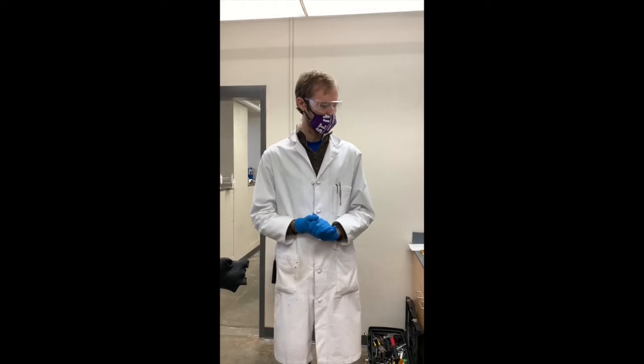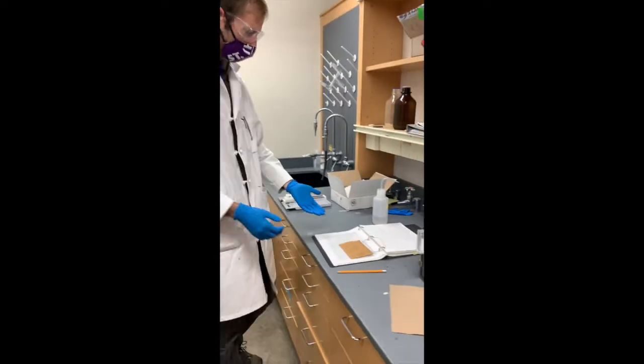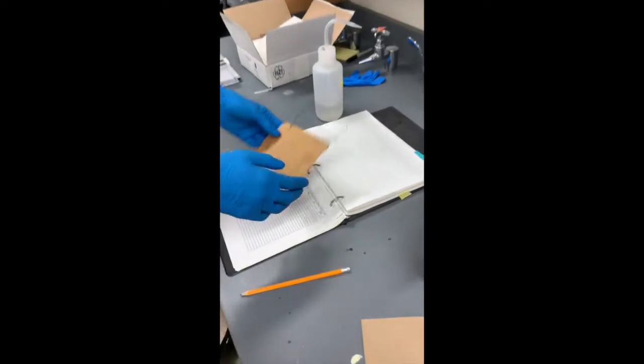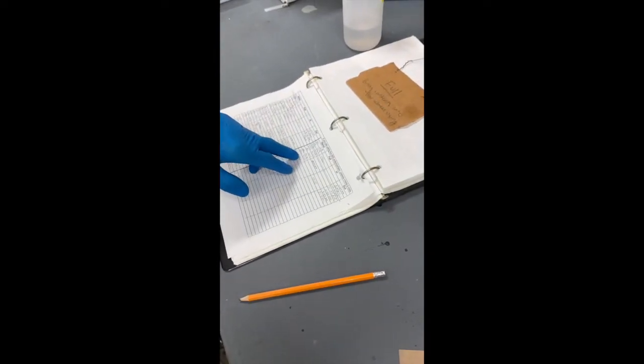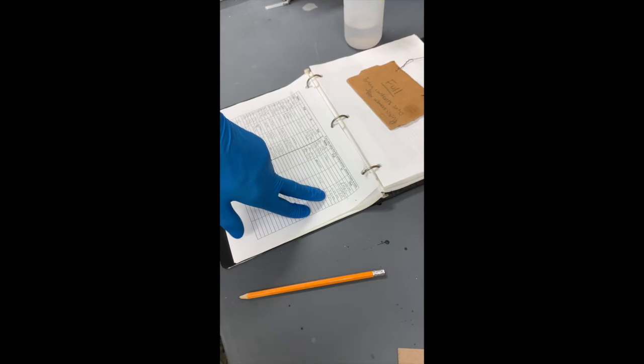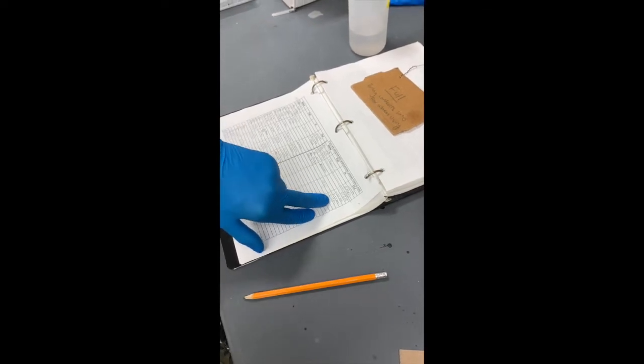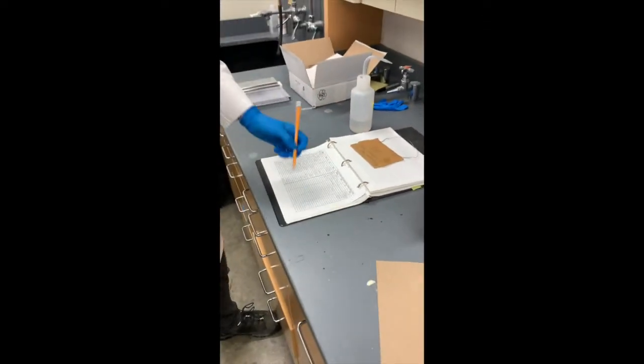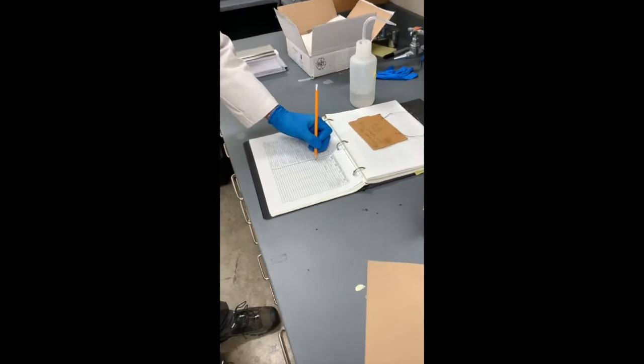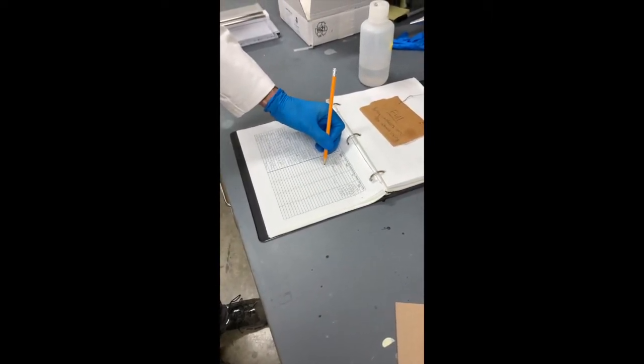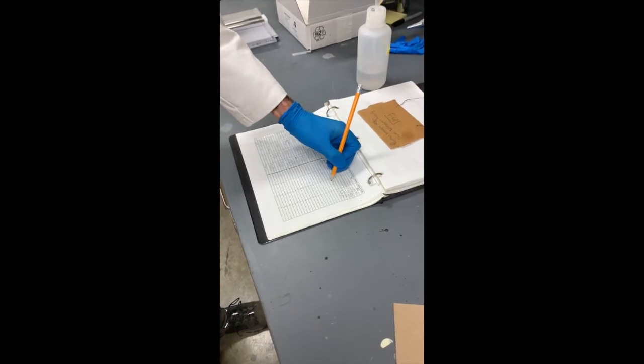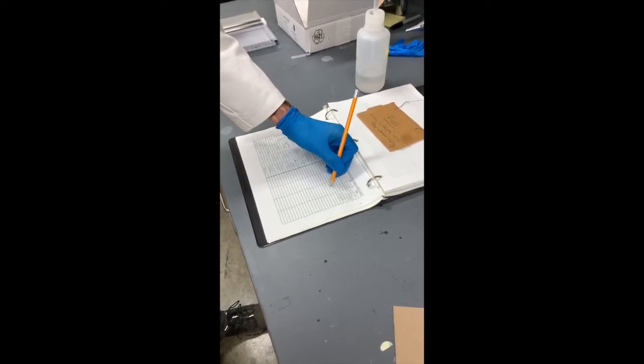So first things first, we're going to come over here and look at the sign-in sheet and make sure that nobody's in there right now. Looks like Grace was in here earlier today but she came out at 2:15 so we're all done. So I'm going to sign in with the initials and the date. I'm going into the box, it's about 3:15 p.m. right now.